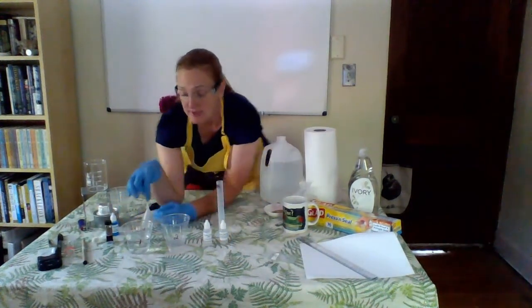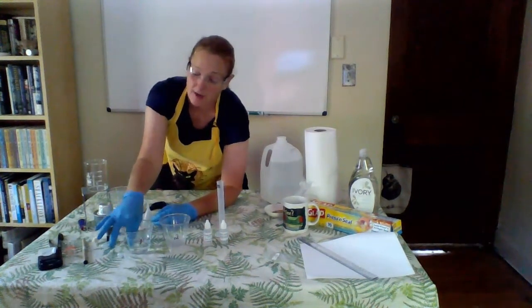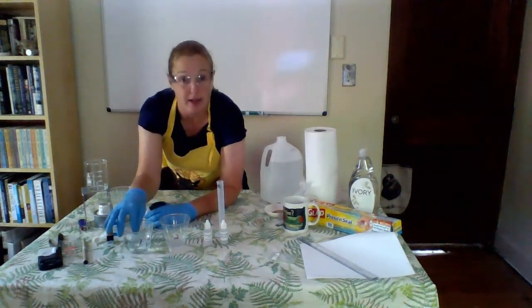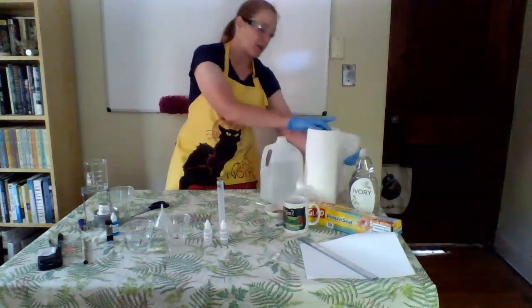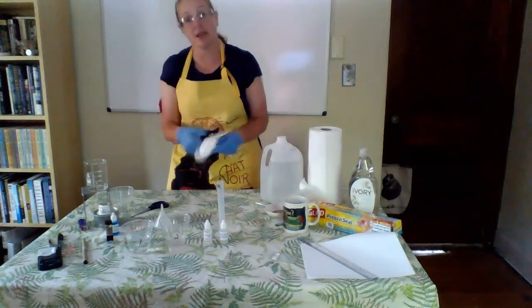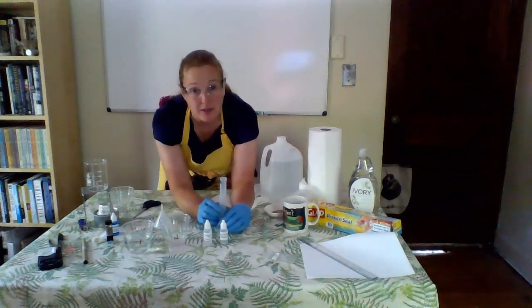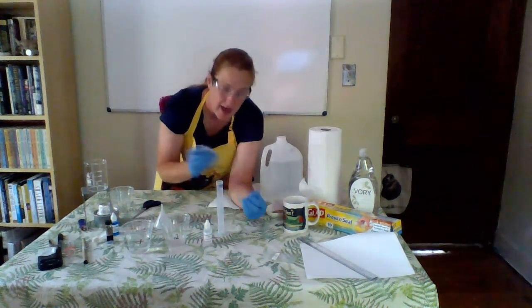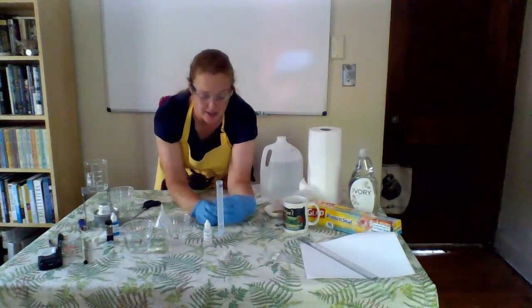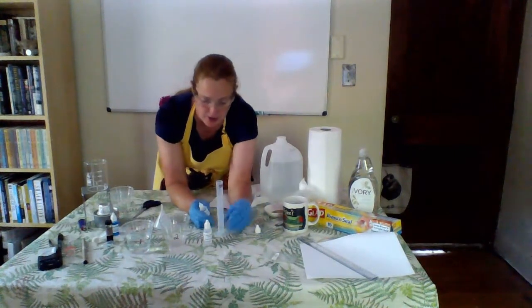And that's why the first thing we need to do is to get a cup full of distilled water. We dump in our dialysis tubing, and this is going to start to soften that up a little bit more. Make it a little bit more malleable so that we can experiment with it. So, my dialysis tubing is soaking in my distilled water. In my graduated cylinder, I've already measured in the required amount of distilled water. So I'm going to add in my starch solution. I'm going to give it a little bit of a shake in case any of the contents have settled. And for my starch solution, I know that I need 2 total milliliters.